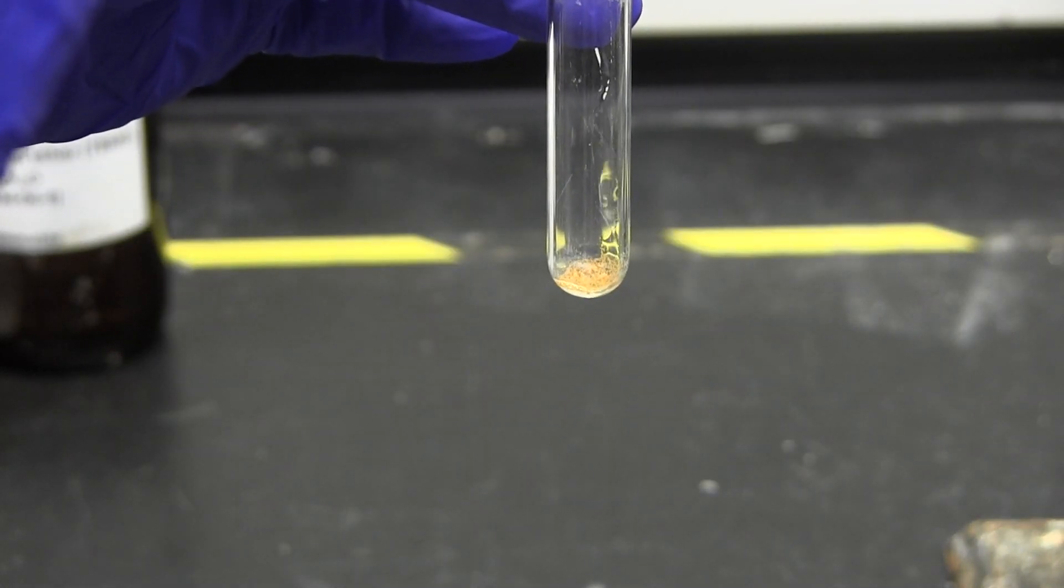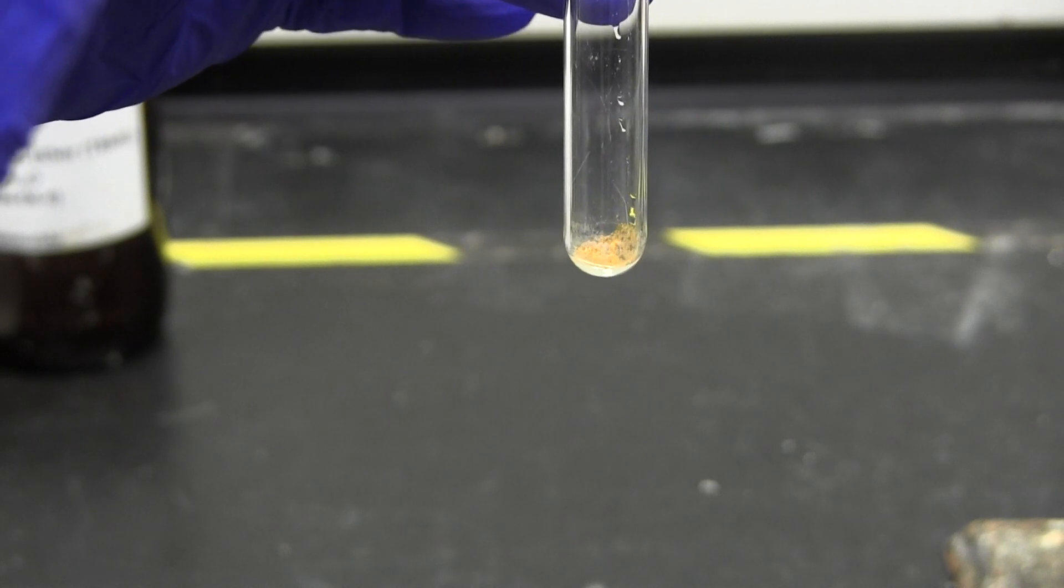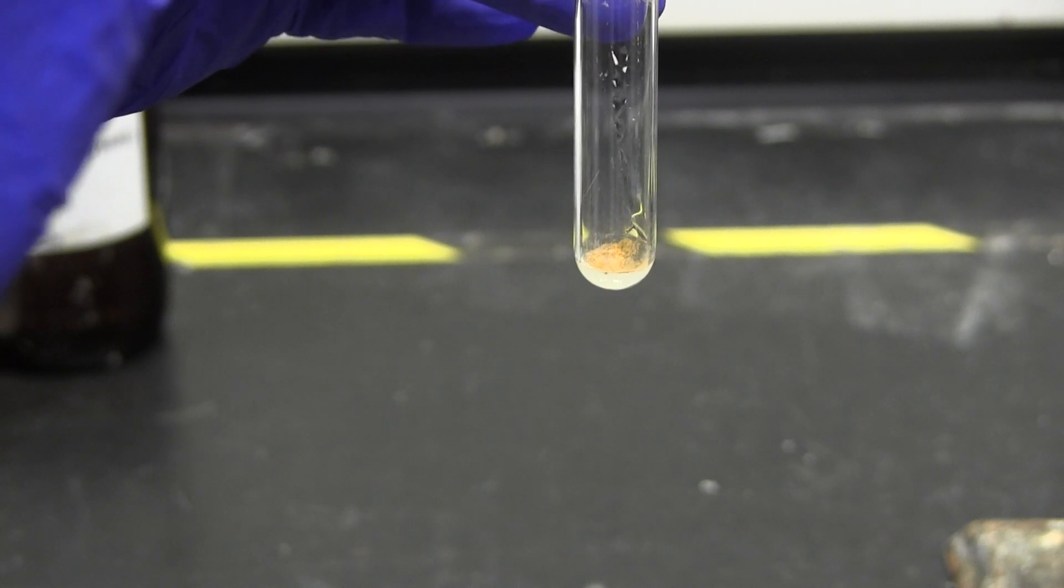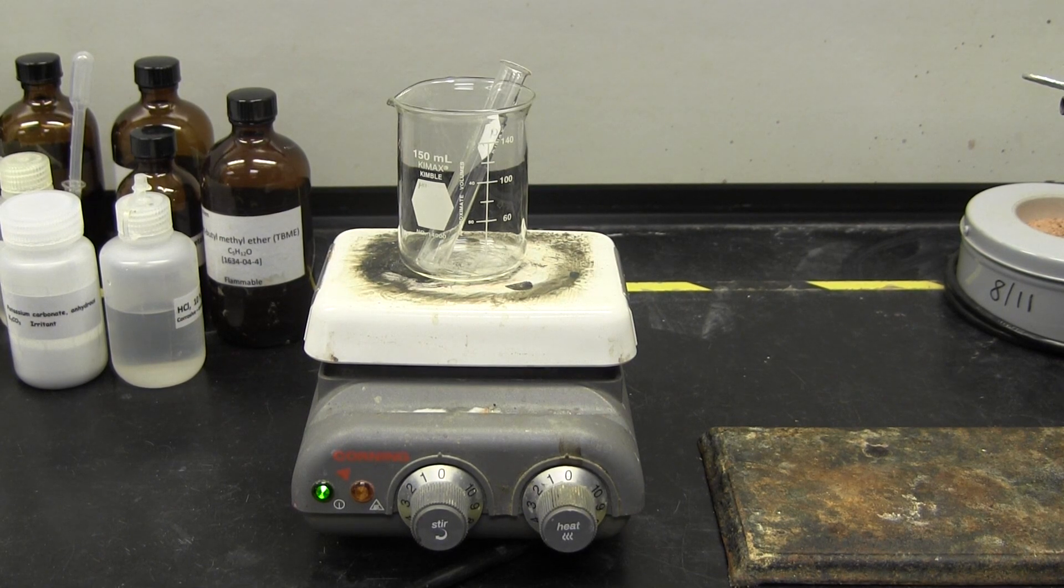In that case, use your best discretion to choose one. Once you have selected your solvent, you will set up the recrystallization glassware. You will need a test tube, beaker, and a hot plate.